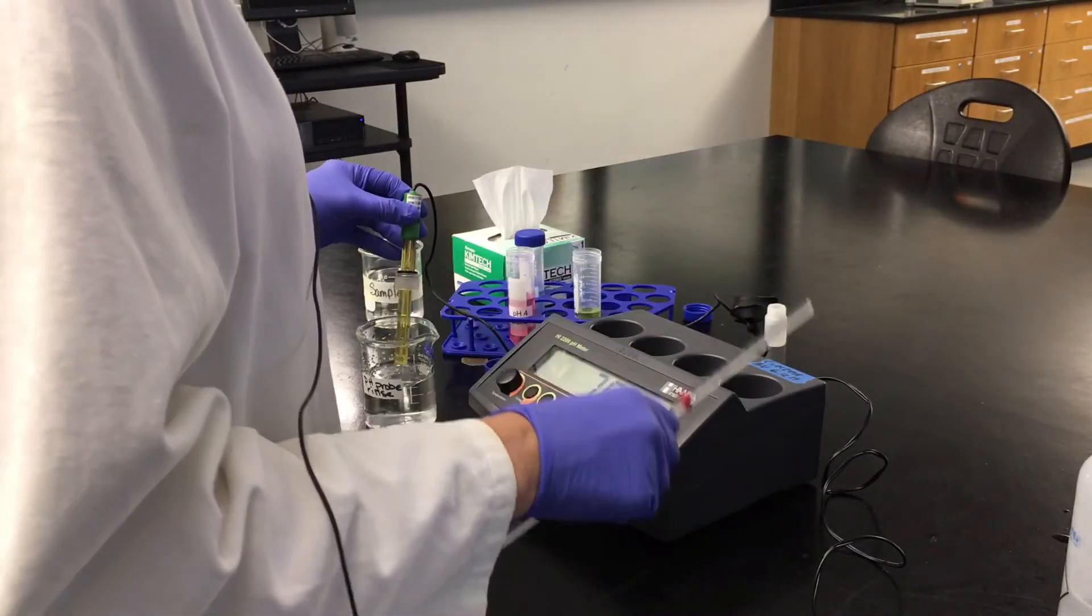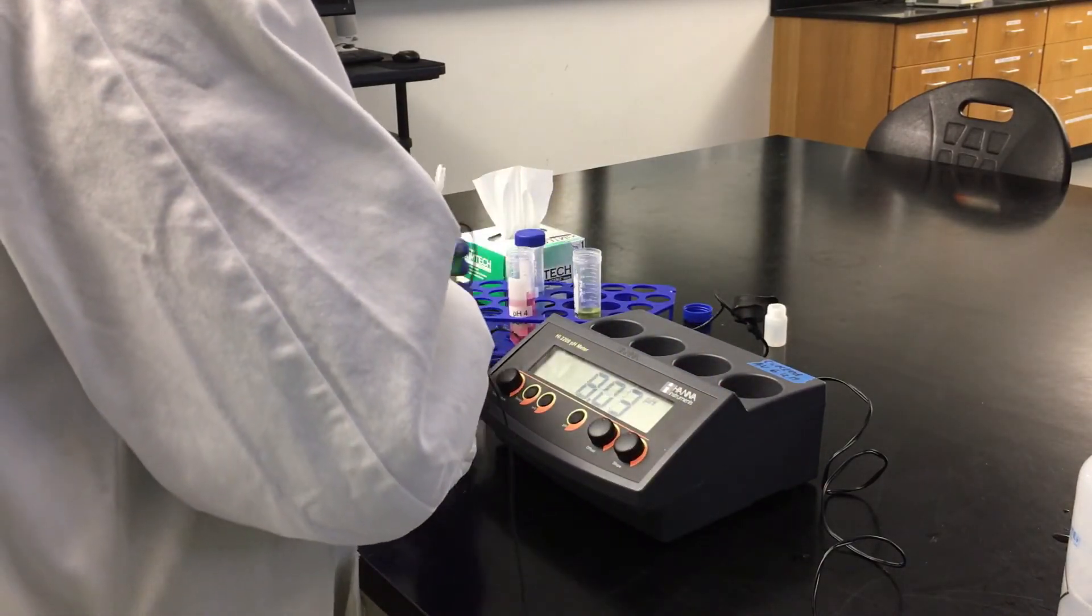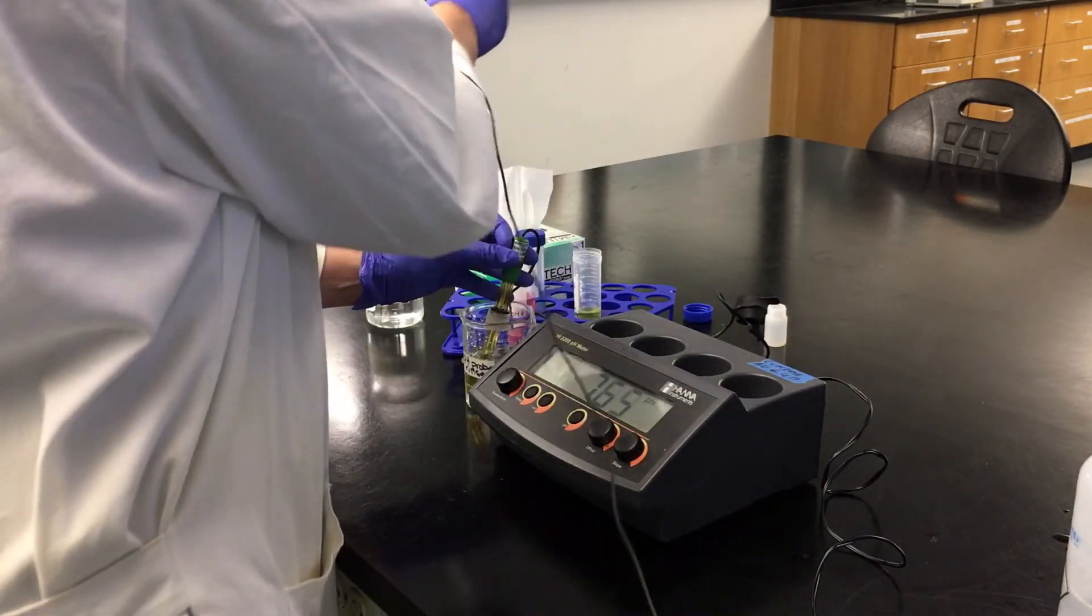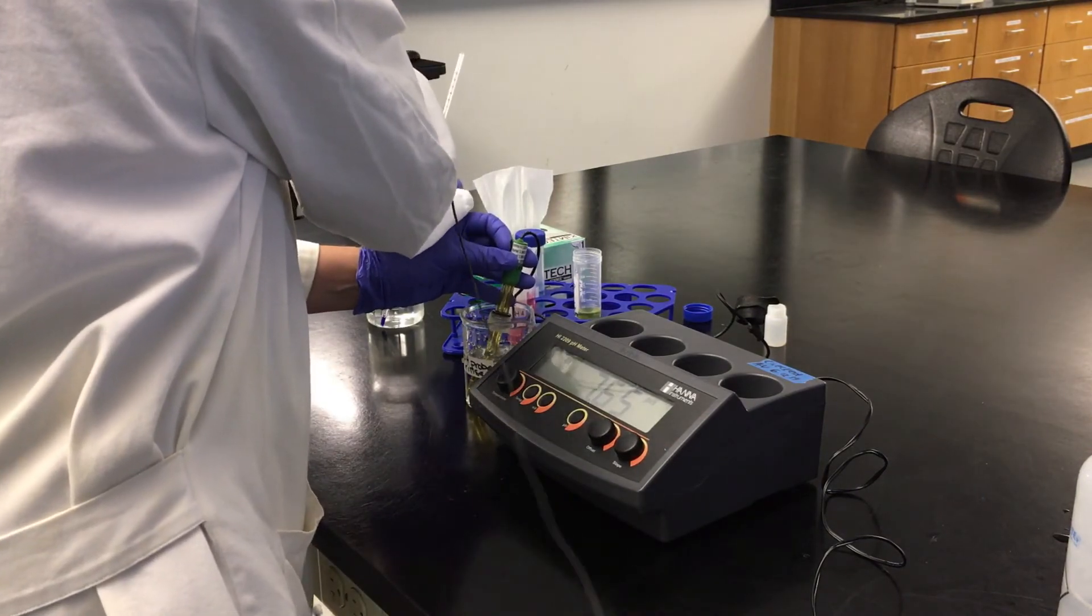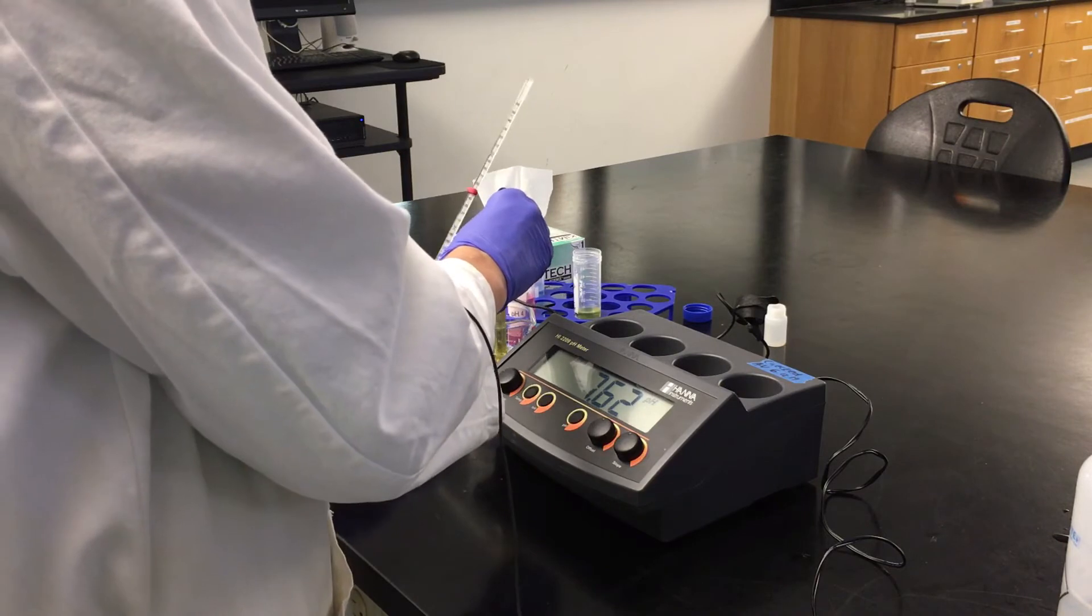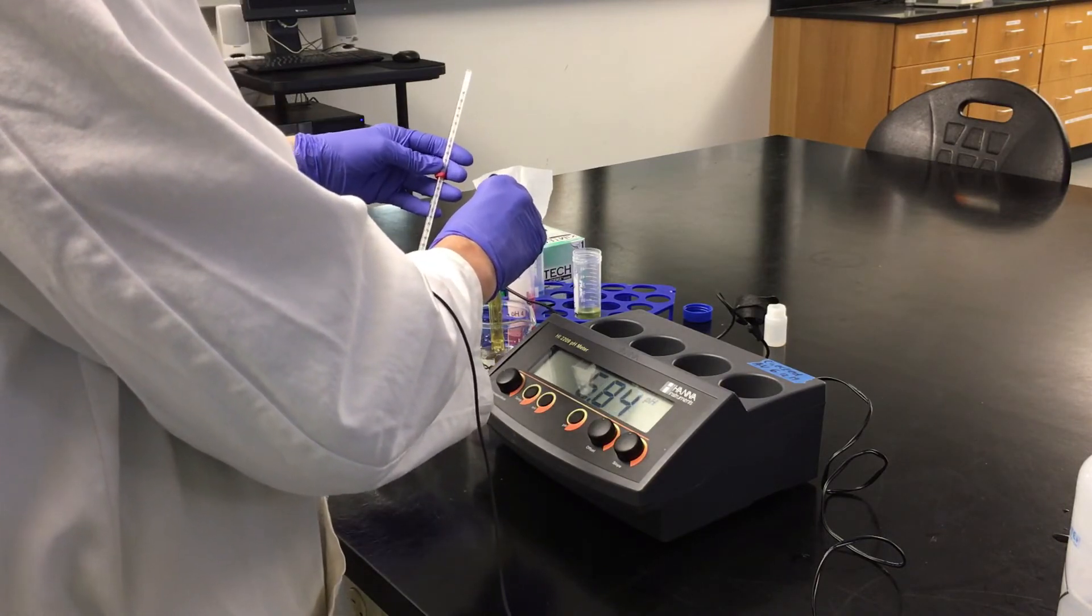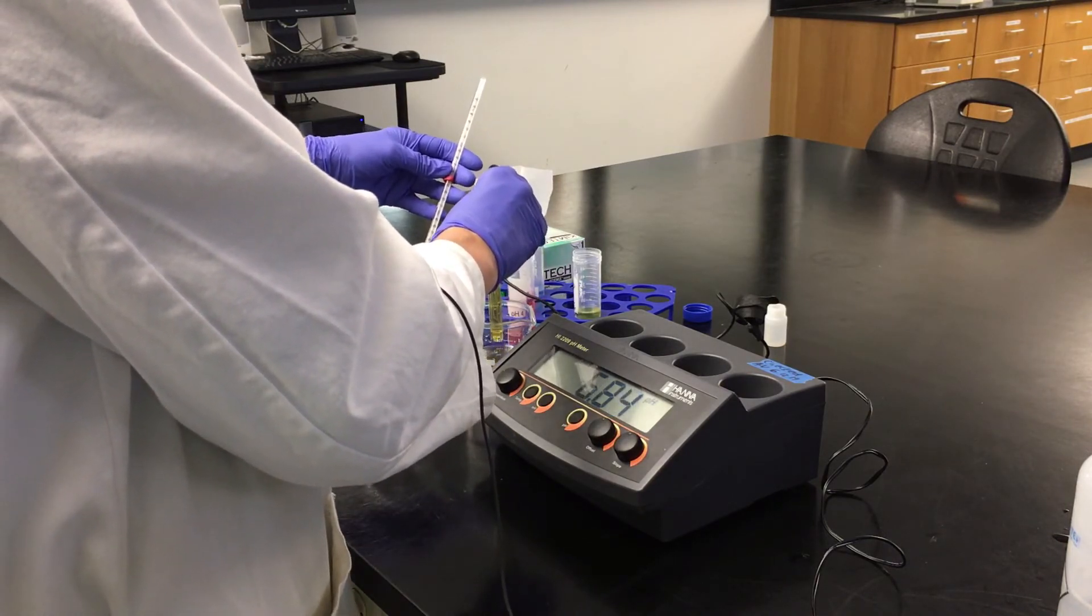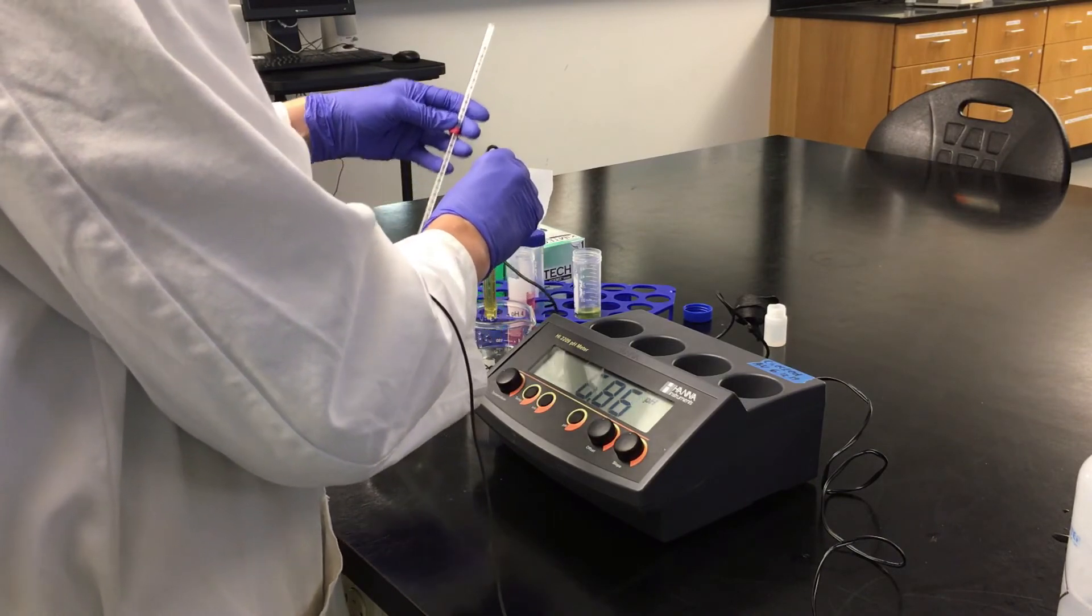Once you've calibrated your instrument, you're going to want to take a measurement of your sample. But first, you want to determine the temperature of your sample. So this is our sample, which is also 20 C.